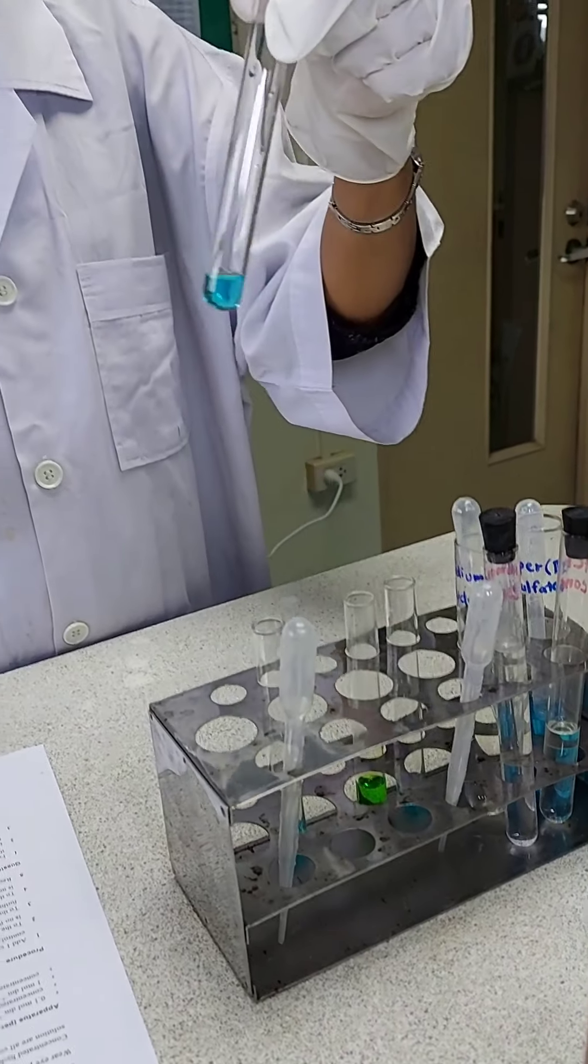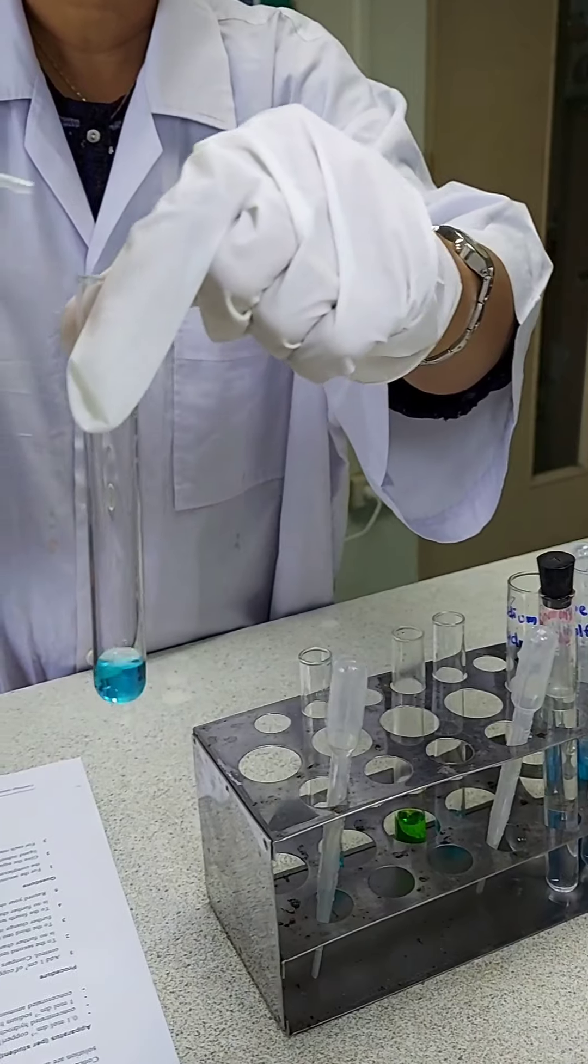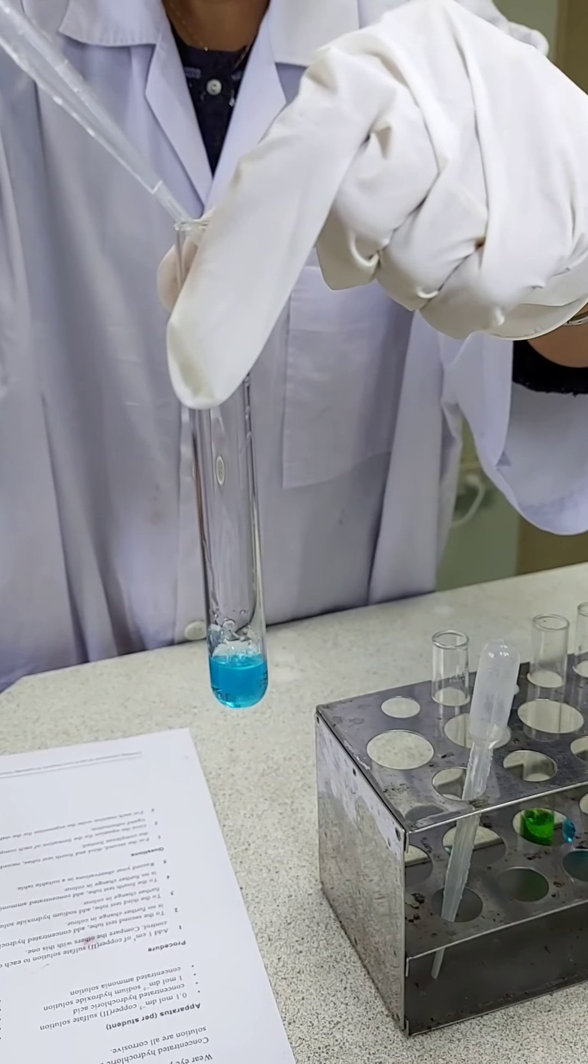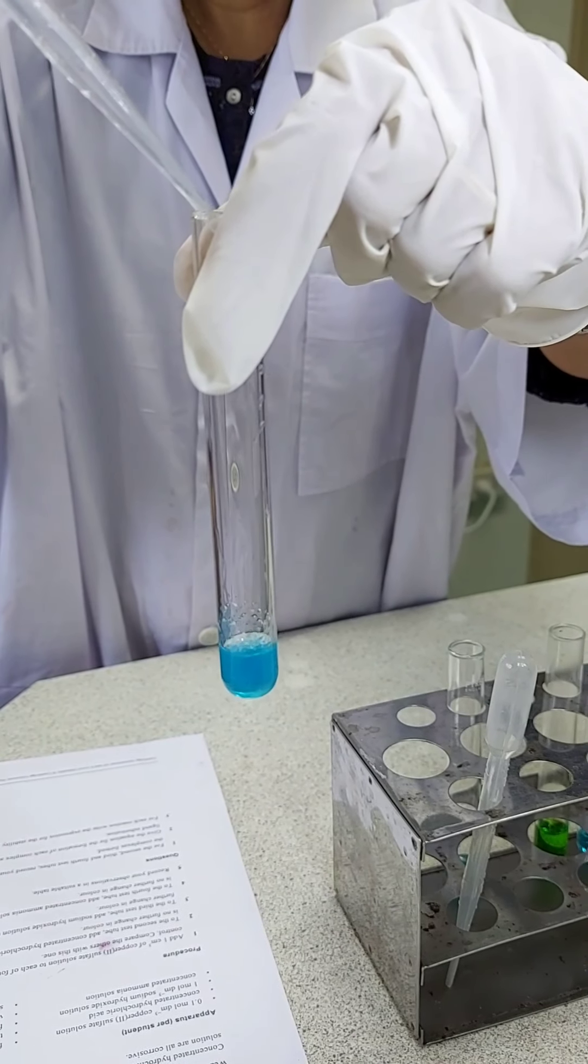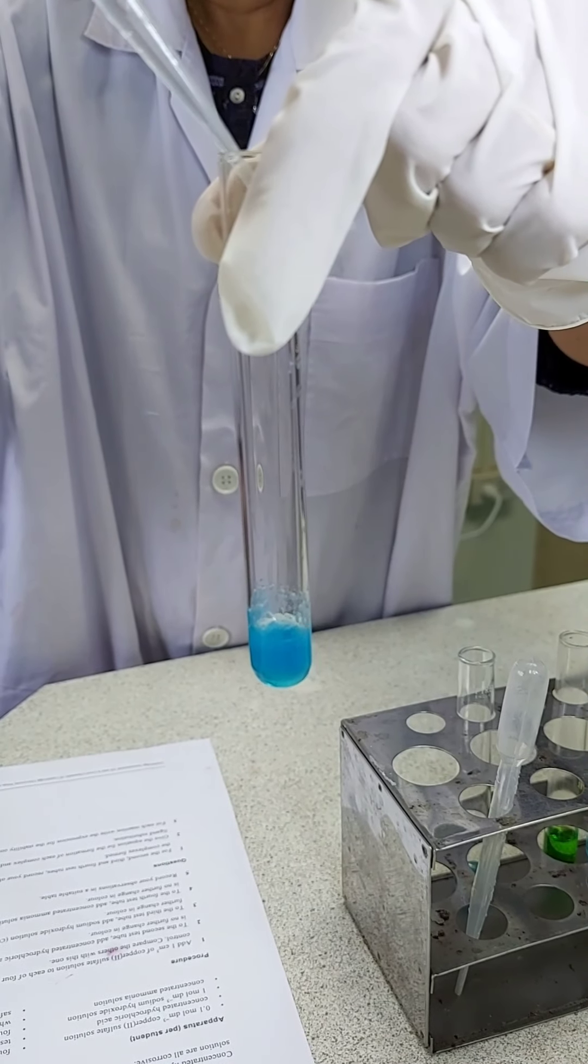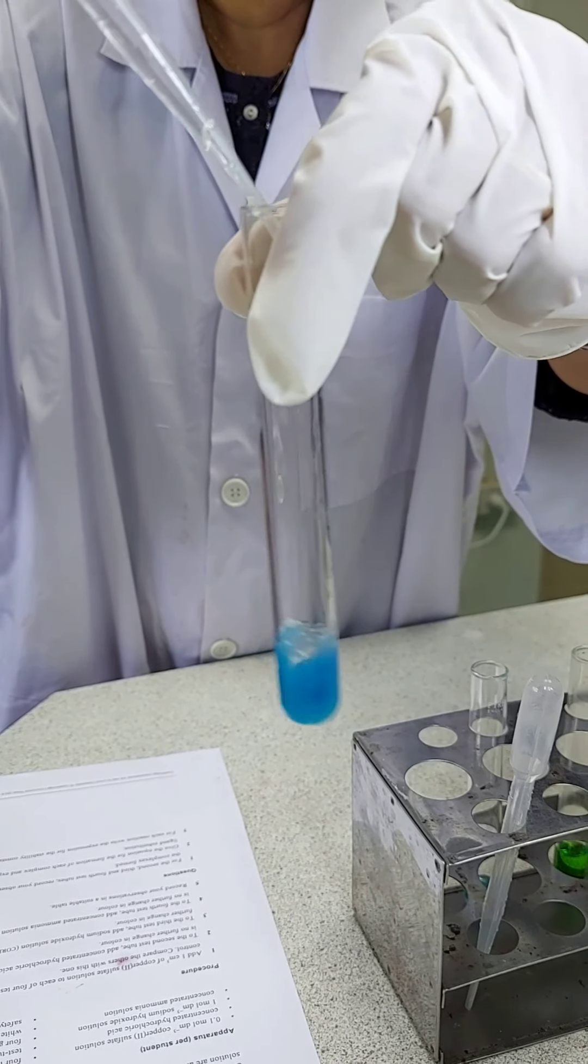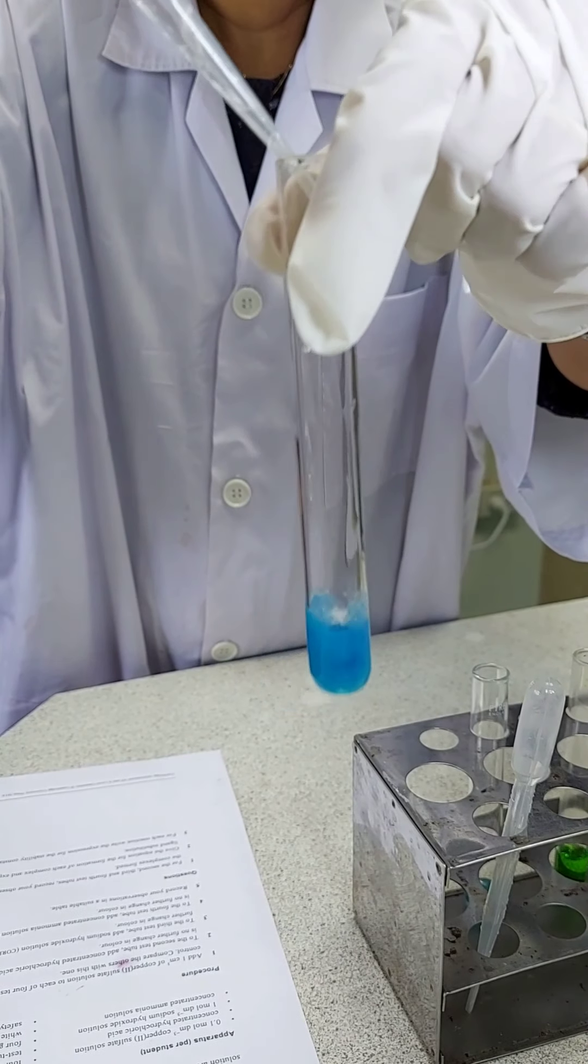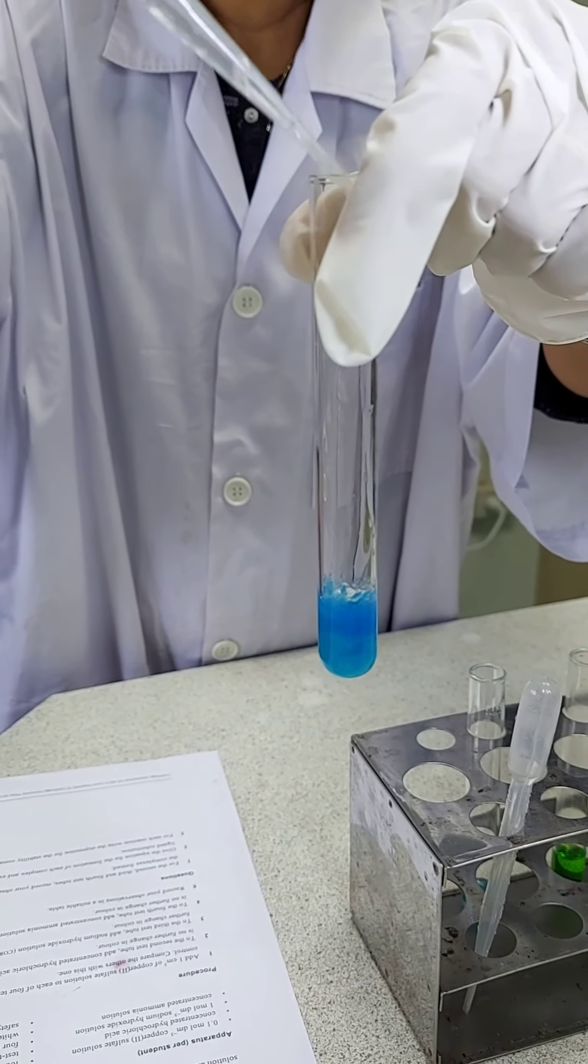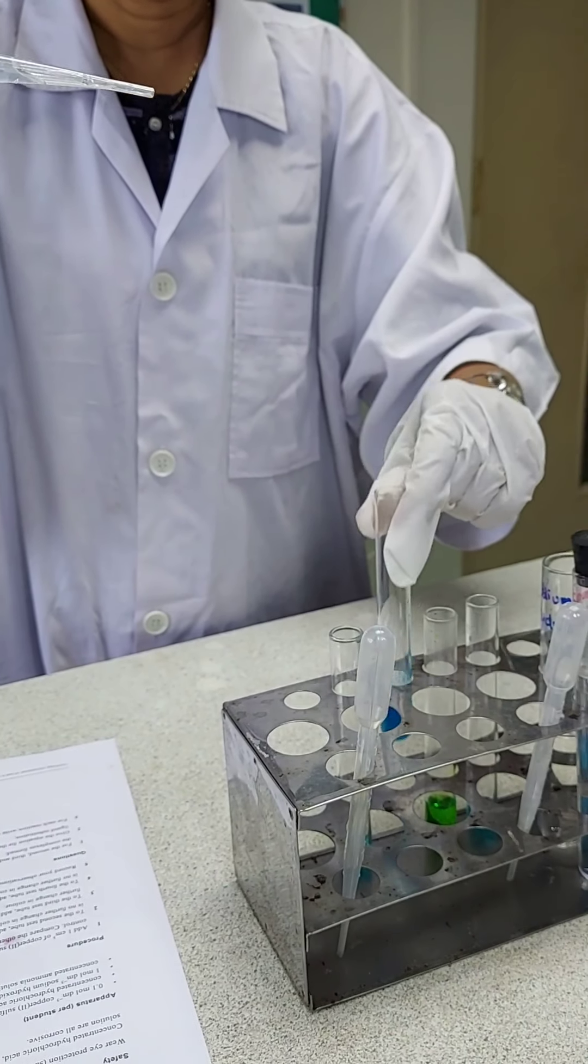To the third test tube, I'm adding the 1 mol per dm³ sodium hydroxide drop by drop again till there is no color change observed. Clear observations to be made. No further change in color then.